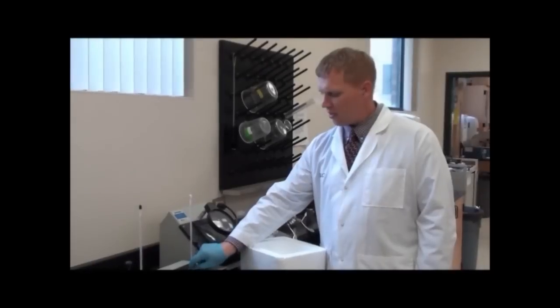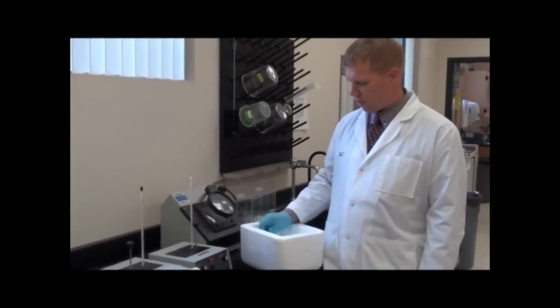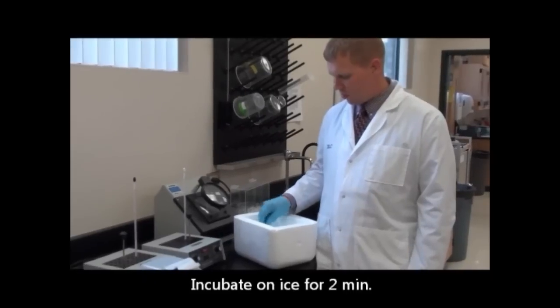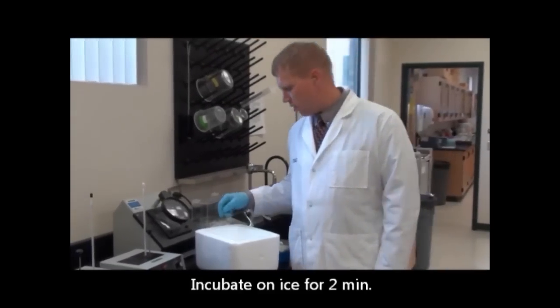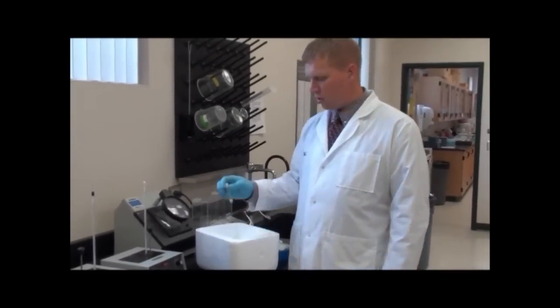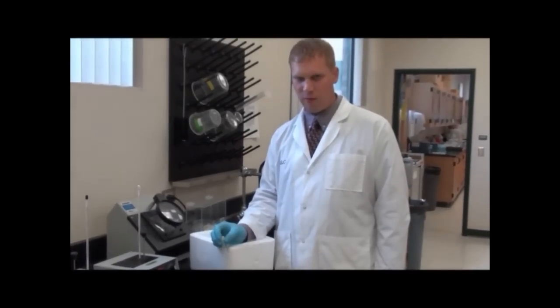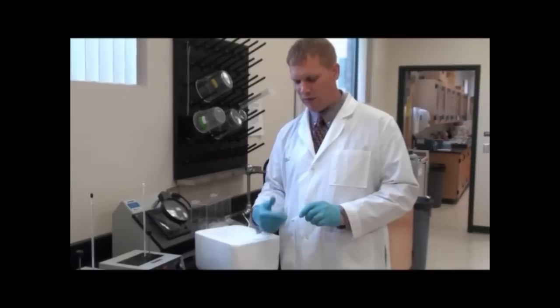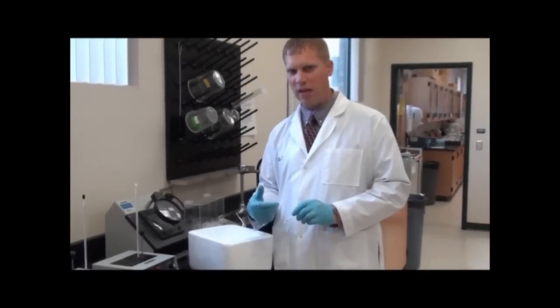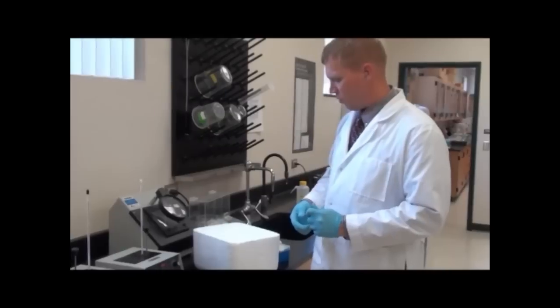At 90 seconds, we're going to pull it off, put it back on ice, and wait for a couple minutes while that cools back down. Then we'll transfer that solution into some SOC media in a small culture tube. This is a recovery media that will allow the bacteria to recover from heat shock and start producing the antibiotic selective marker that is given with the plasmid.